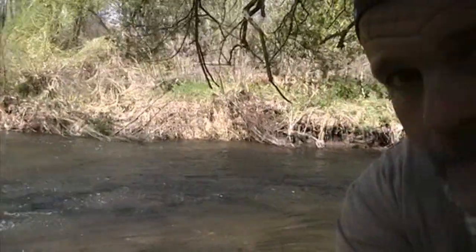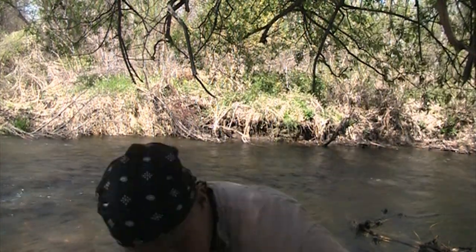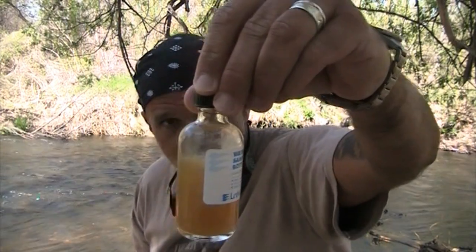So, back to the sample bottle. With the help of the duck's distraction, if you look, do you see how the solid has formed and it's about a third of the way down? You want to get the precipitate at least a third of the way down. What's going to happen is half of your students are going to be unhinged and want to shake the bottle, and you're going to have to make them wait.